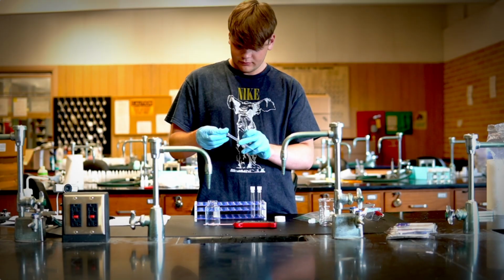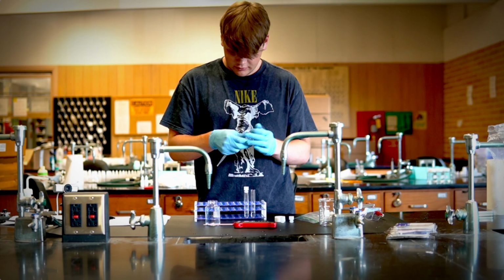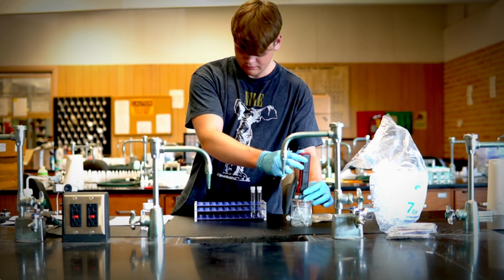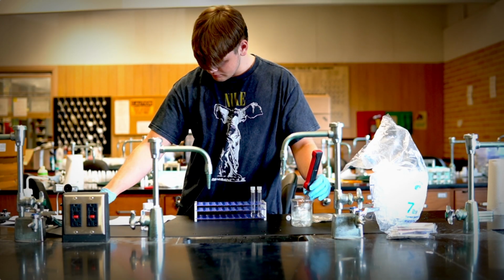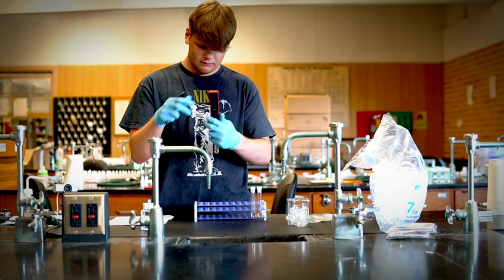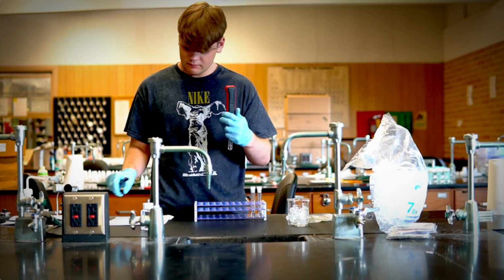After you've added all your water, you're going to do 2 measurements: one in the ice before and after, and then you measure the temperature inside the tube. The temperature inside the tube will be the temperature before you put it into ice. That will be at time 0. So we're going to measure the temperature at certain times. Time 0 will be the temperature before we put it into ice.